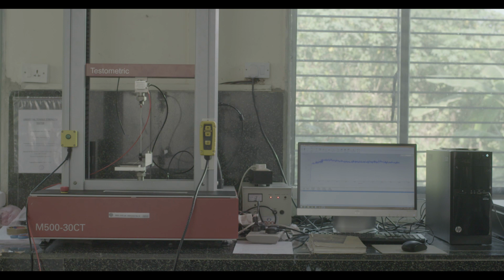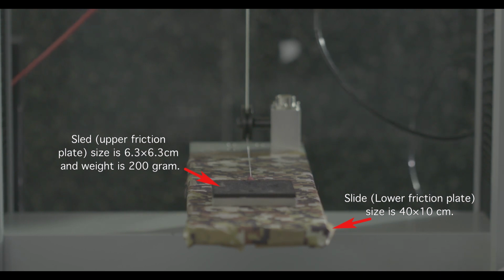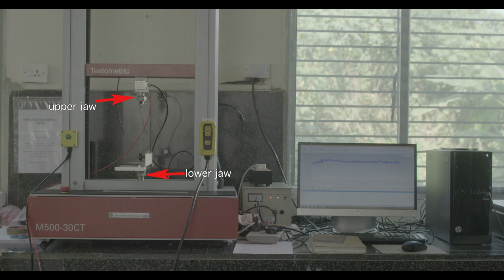SOP: The tensile testing machine is CRE principle based and is provided with the following arrangements. One sled and one slide are provided for friction testing. Sled, upper friction plate, size is 6.3 × 6.3 centimeters and weight is 200 grams. Slide, lower friction plate, the size is 40 × 10 centimeters. The friction slide is attached to the lower fixed jaw and the friction sled is kept above the friction slide.